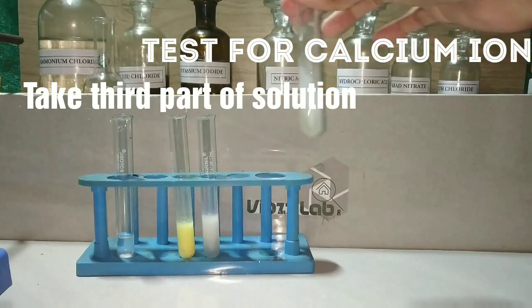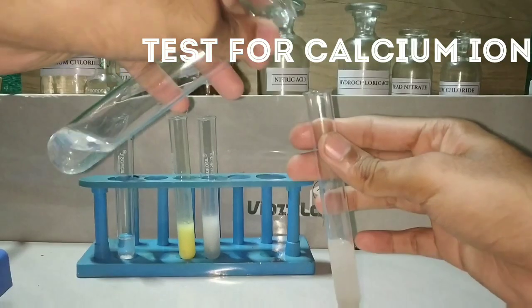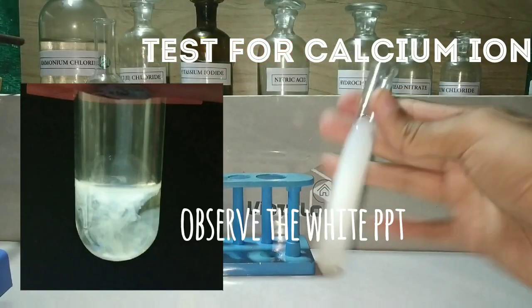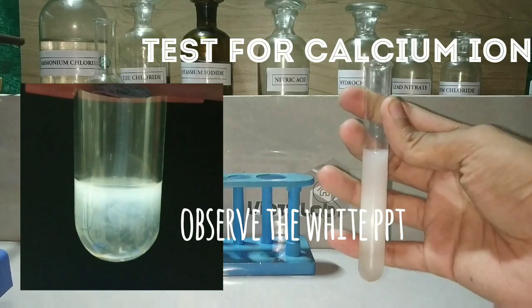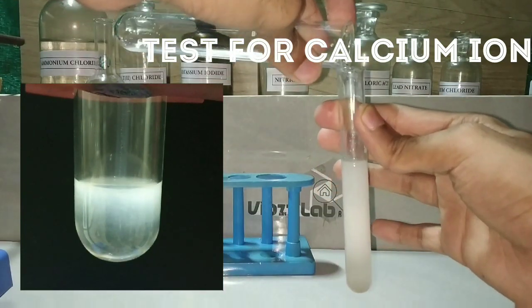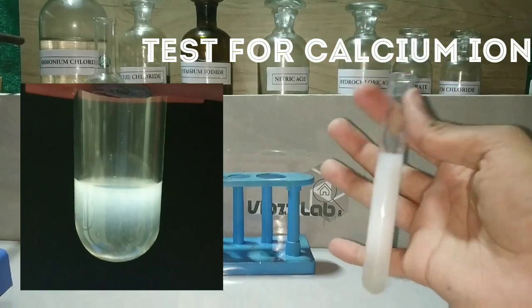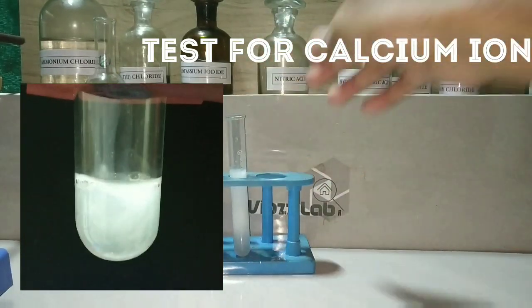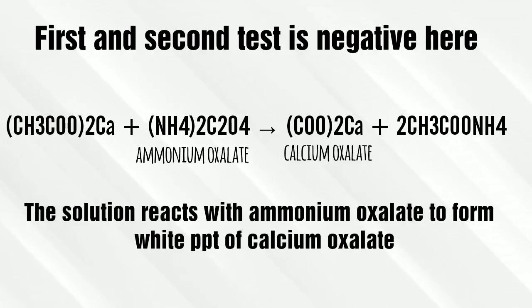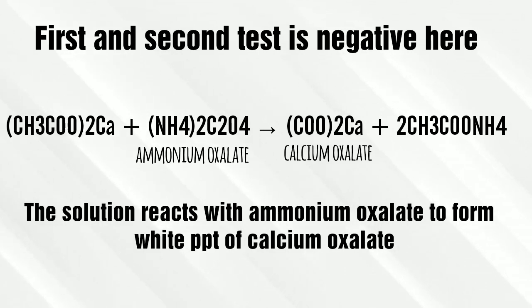In the third test tube, we test for calcium ions. We take the third part of the solution and add ammonium oxalate. On adding ammonium oxalate, there is formation of a white precipitate. The first and second tests are negative for calcium ions, and the white precipitate of calcium oxalate is formed.